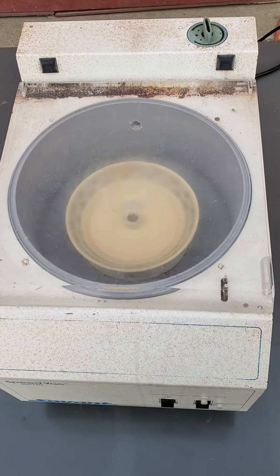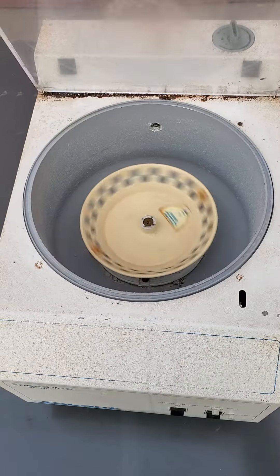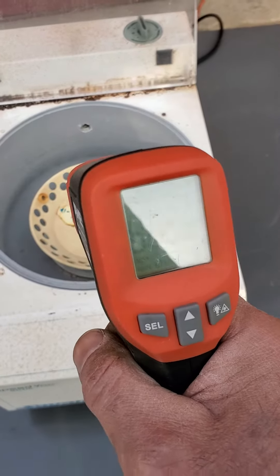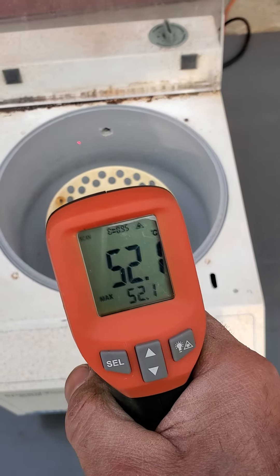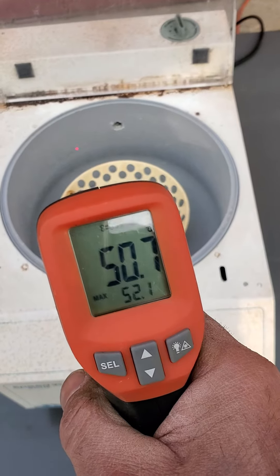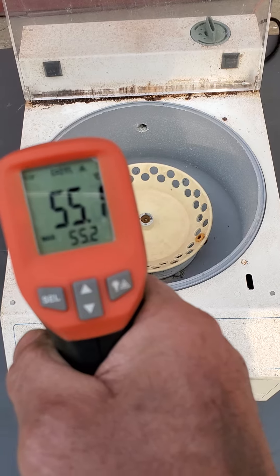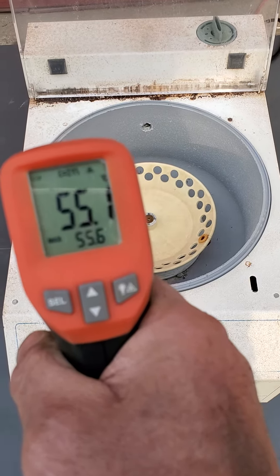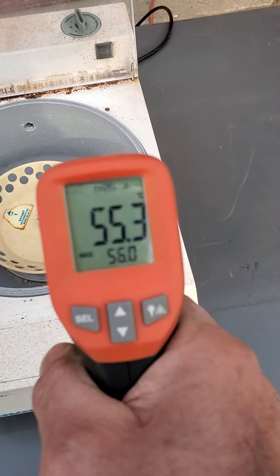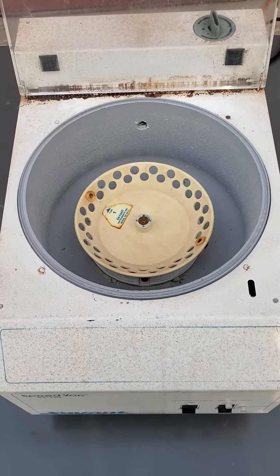It's in perfect operational condition. I'm going to open it up — it's going to stop, of course, as it should. Now let's see the thermometer reading. It's going up: 52, 53, 55. So it does heat up perfectly. There's nothing wrong with the heating either. Operationally, perfect condition.